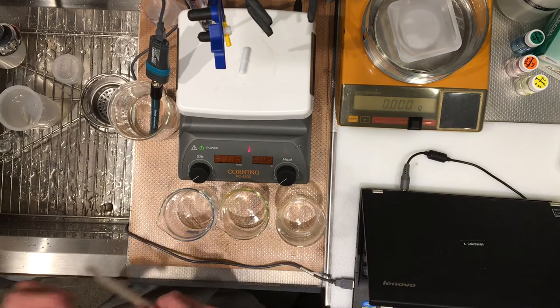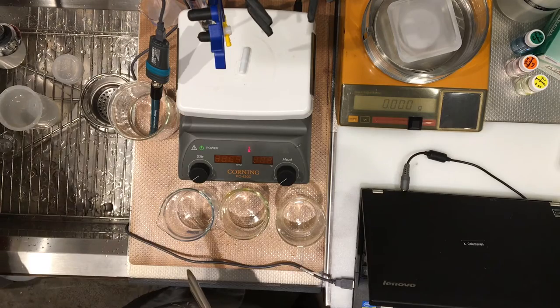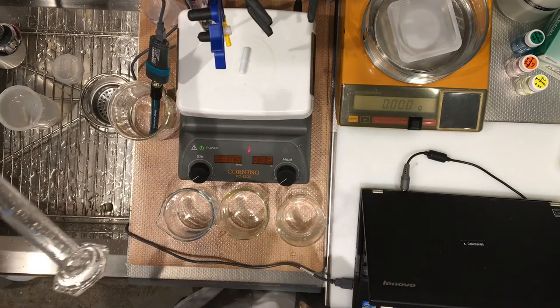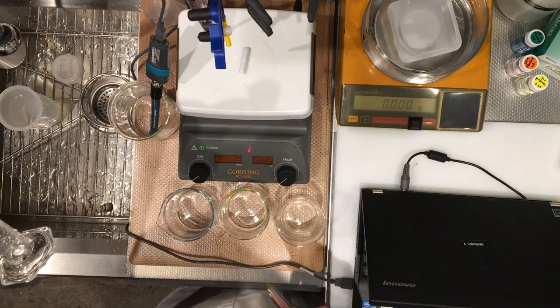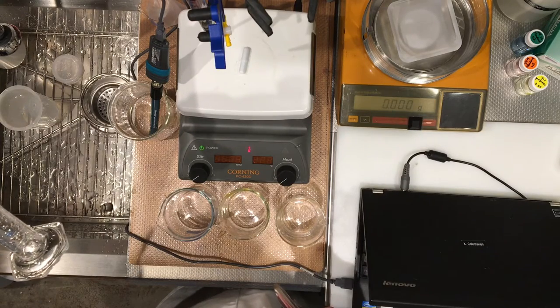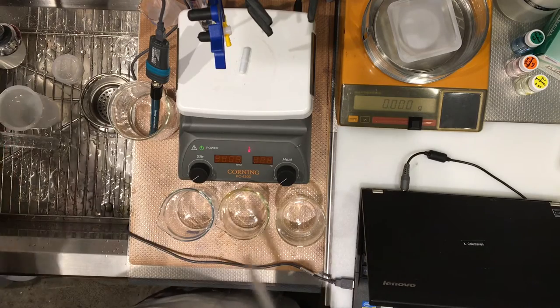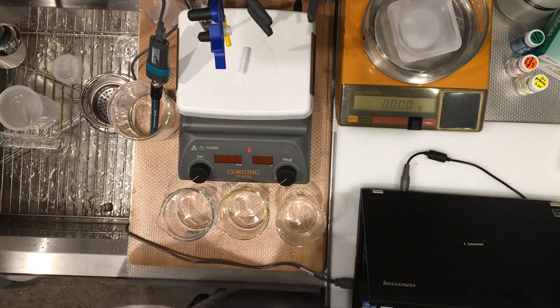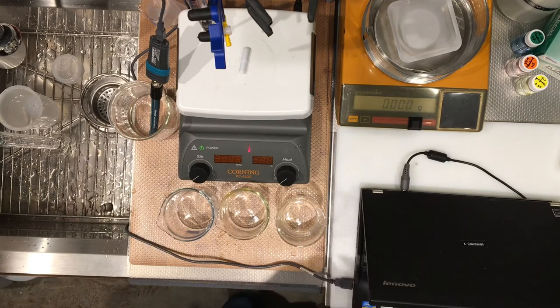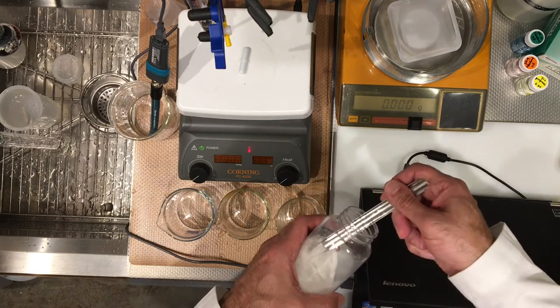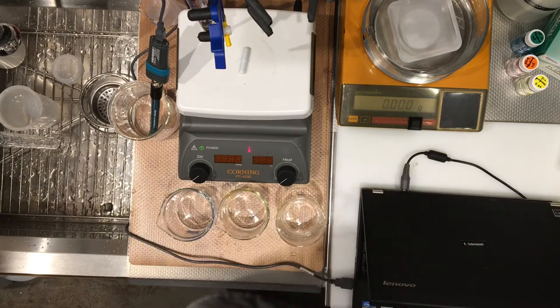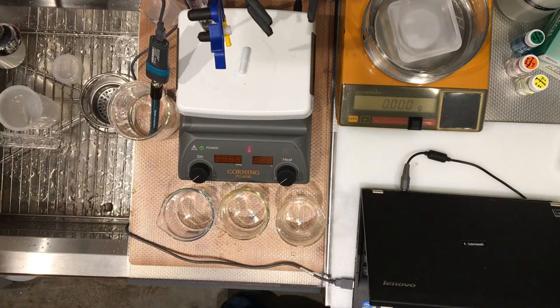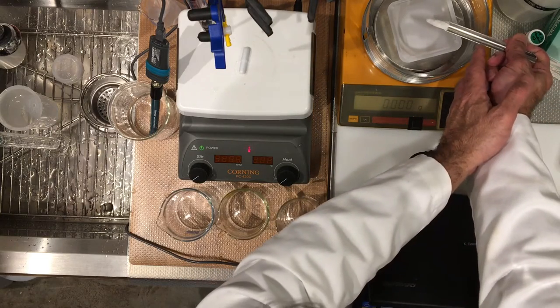And we're going to be adding 25 milliliters of water to mix with this. Actually, I'm going to, yeah, we'll go with 25, I think 25 will work fine. Might take a little while for the solid to dissolve, but we'll see. So let's start with samples, please record these values in your notebook. So the first sample, and these sample masses are going to be roughly about one grams. So let's go ahead.